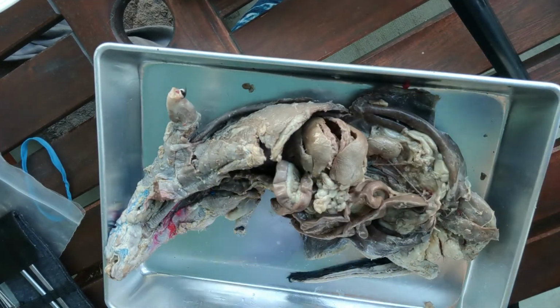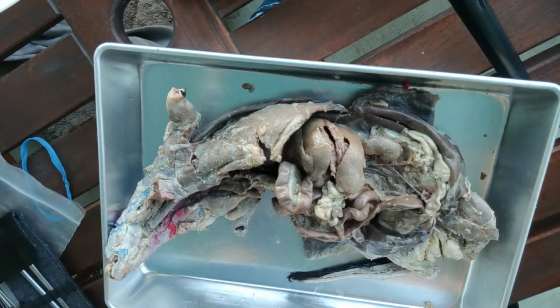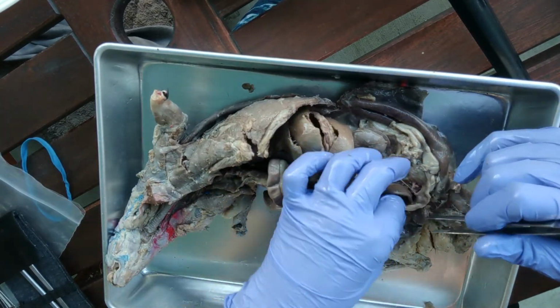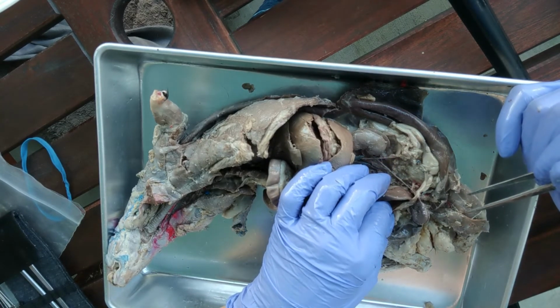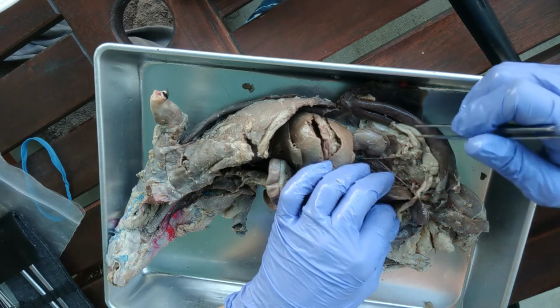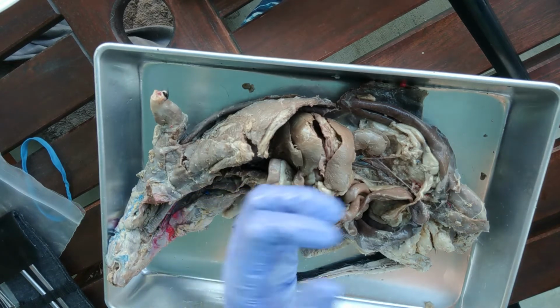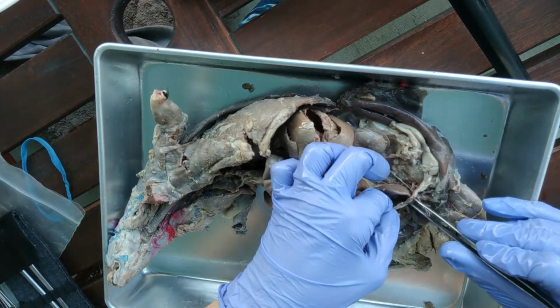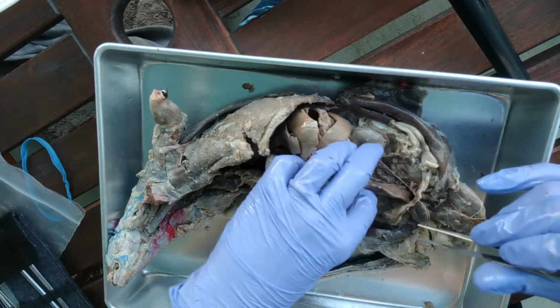Okay, and then one other thing, the reproductive system. So mine, in this mink that I have, is a female. One interesting thing about the females is that the minks, because they have litters instead of singular births or twins, can have multiple births at the same time. They have a different structure for their uterus. Okay, so here would be the vagina, and here is a very specialized uterus.